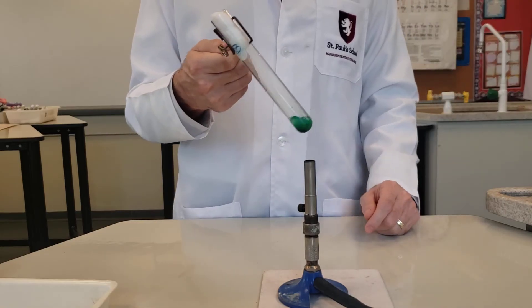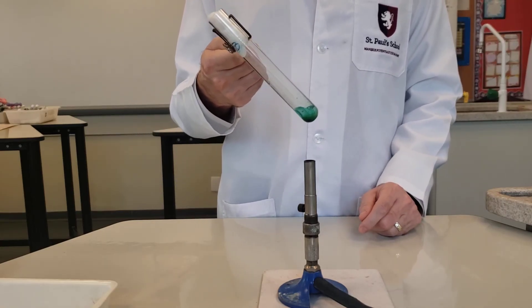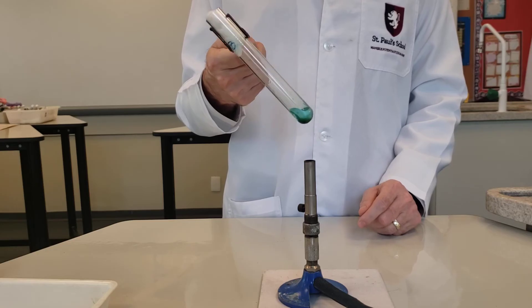Now I'm getting to dry copper nitrate. You can see it's more of a greenish color, and we should be able to see something else happening now.